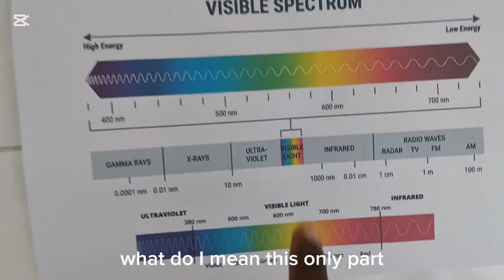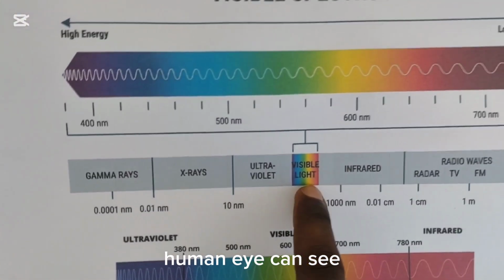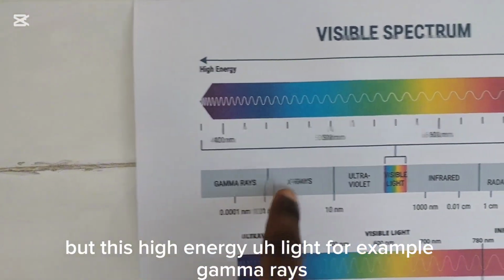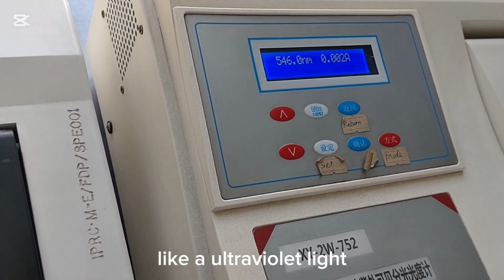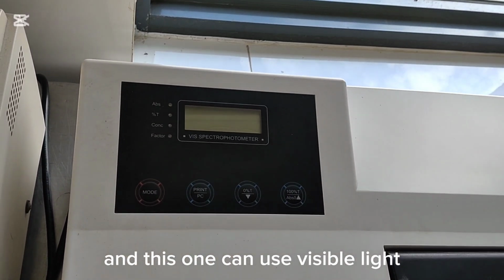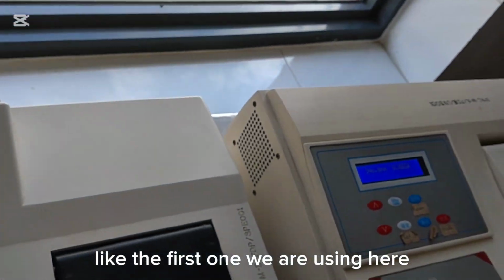What do I mean? This is the only part our human eye can see. But these high energy lights, for example gamma rays, X-rays, and ultraviolet, we cannot see. But this machine can make use of them, like ultraviolet light. And this one can use visible light. And this one is the same as the first one we are using here.